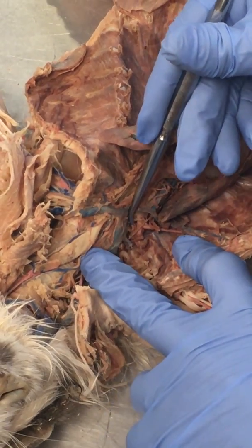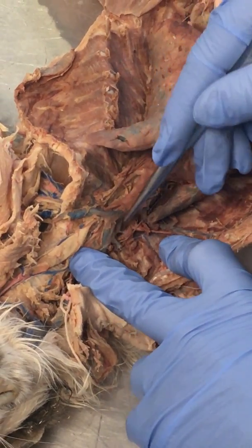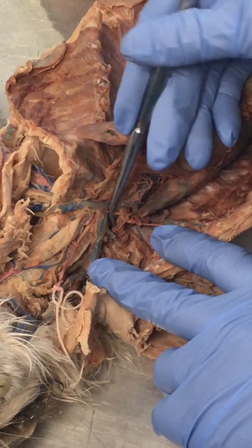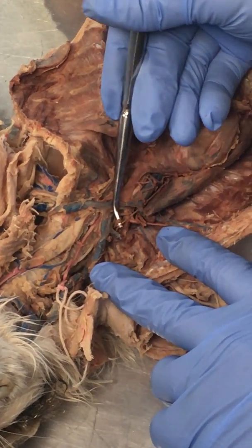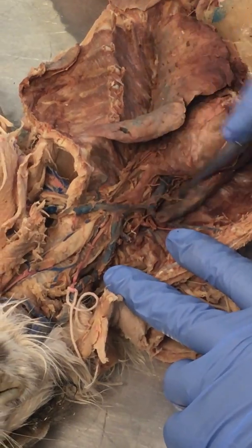And I'm not seeing it. It looks like it was here, probably cut. But that's very common for that to happen. Sometimes we see beautiful ones, but I'm not seeing a great one here. That's probably it. That's not bad, but that's going to be probably it right there.